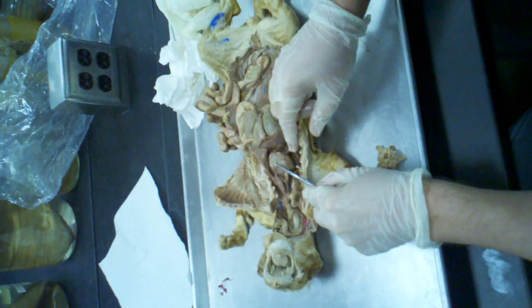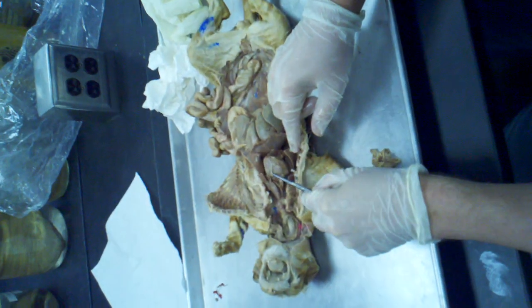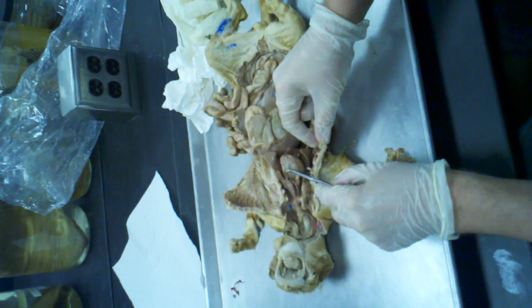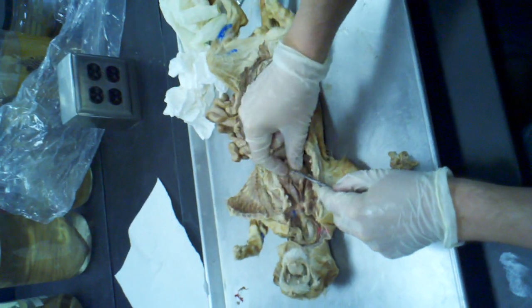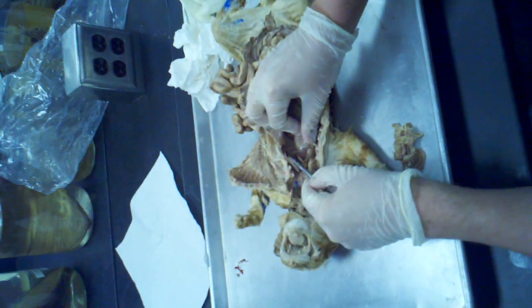Okay, in between. So if I have a probe here, and I go in between the heart and the actual sac, I'm in the pericardial cavity. Notice that that is a cavity surrounding just the heart, so it's protecting the heart. If I remove that in the front, I can't see it on here, but I'm sure most of you have seen it on your cat.